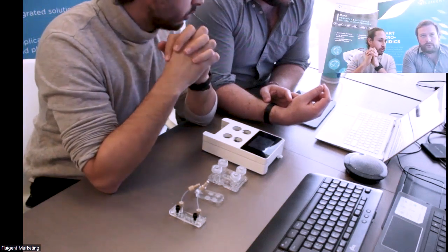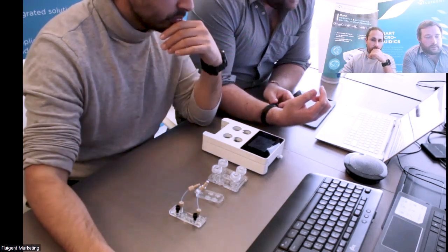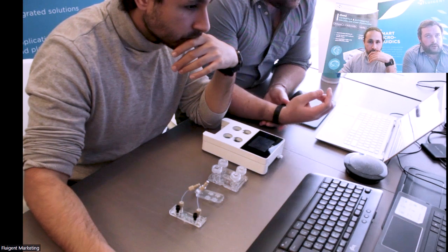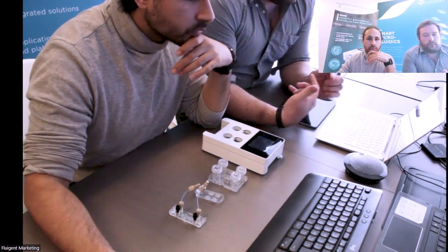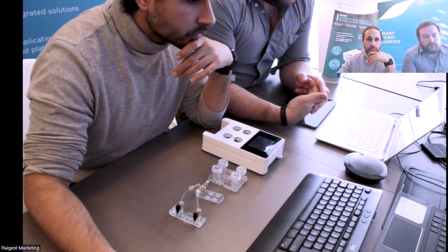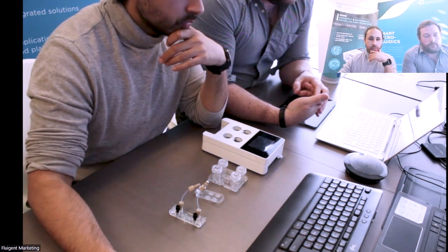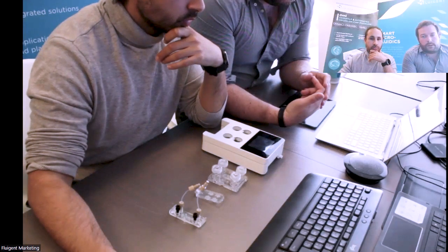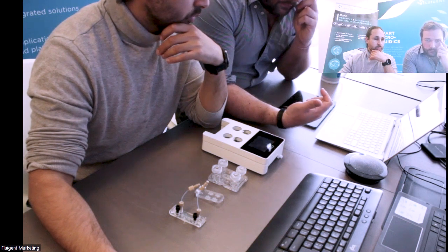You need a security margin so that you don't inject air. Yes, through the protocols, you can totally define all the timings. You can control in time: for a step of infusion, perfusion or recirculation, you can control whether it ends after a given time or when a given volume has been transferred, for example.